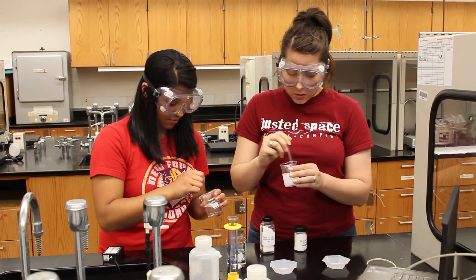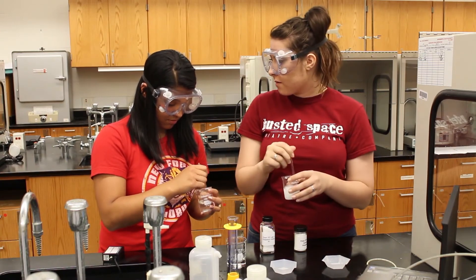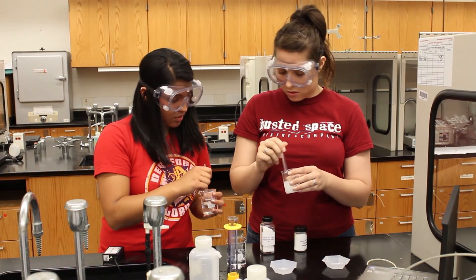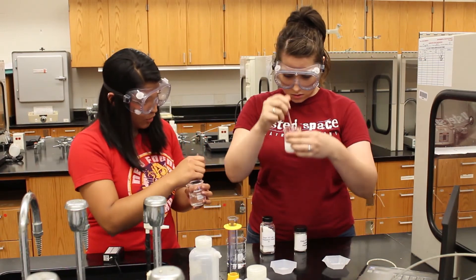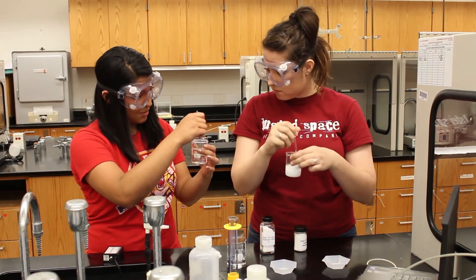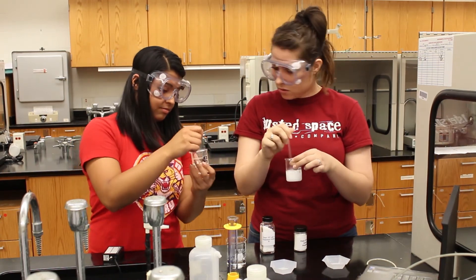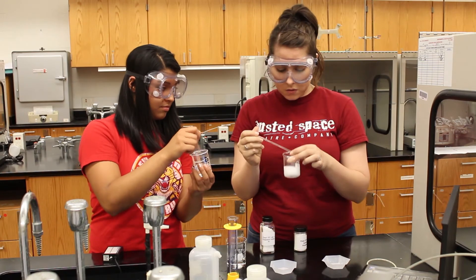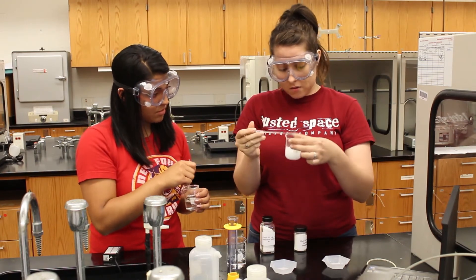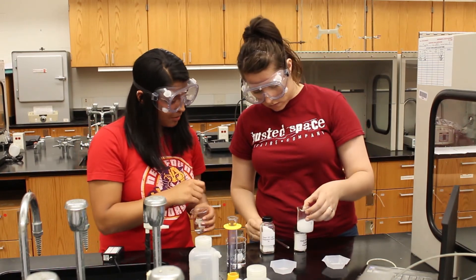Sadie, how will I know if my chemical is dissolving in my water or not? Well, your chemical should dissolve or not be able to be seen — look at mine. So it looks like yours would be insoluble.